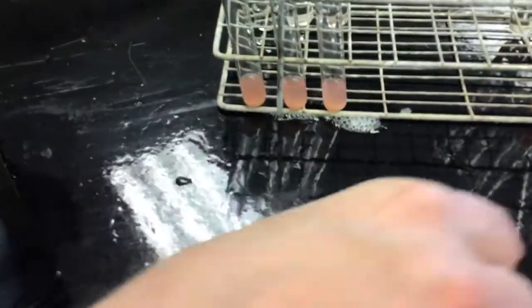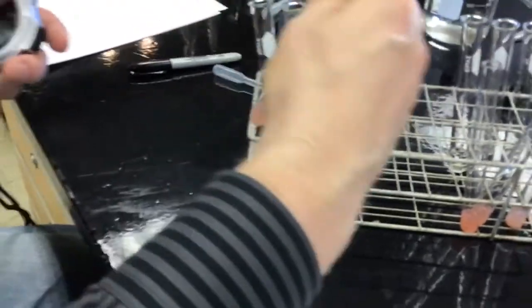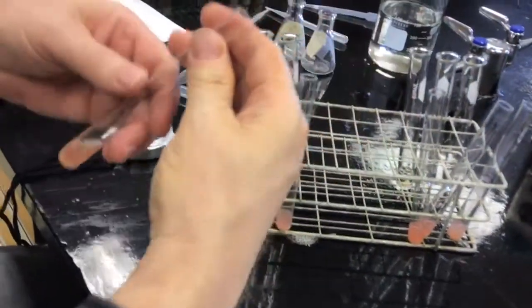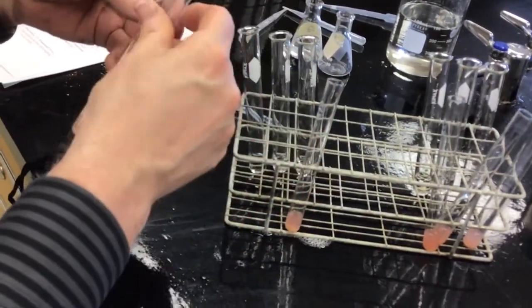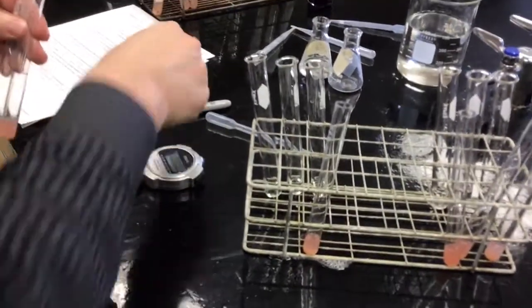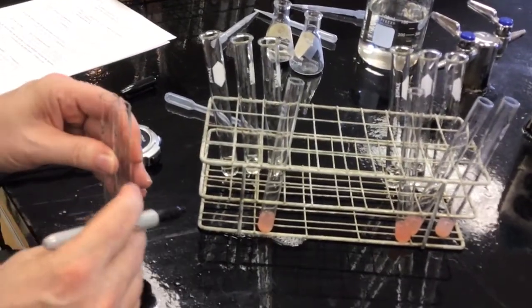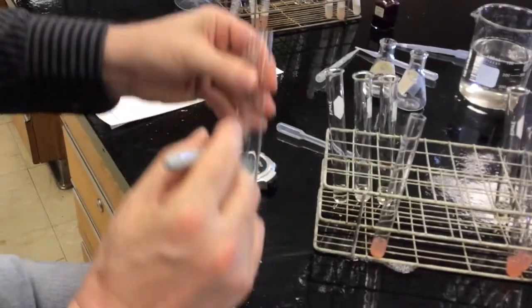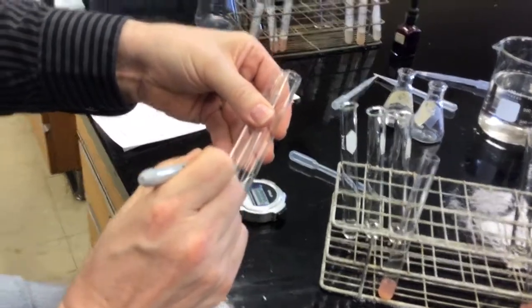Now we're going to 3 milliliters of substrate. Do you have lines on those? Yeah, I can see the lines on these. Whoops. I'll be darned. This one's labeled 3 milliliters. Oh yeah, this one's worn off a bit. I mean, it's Sharpie, but if you handle the test tubes enough, it does wear off. Tap them on the table to make sure they're lined up at the bottom. It helps that I've got a little remnant of a line still on there.